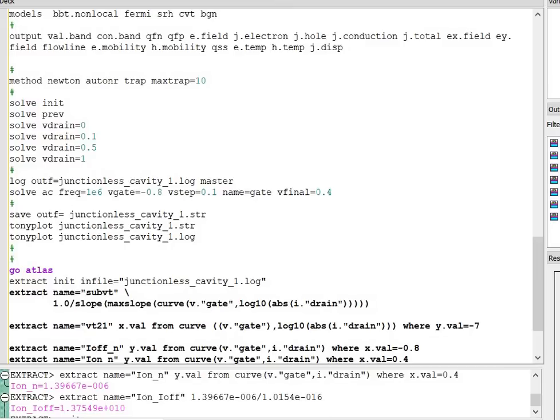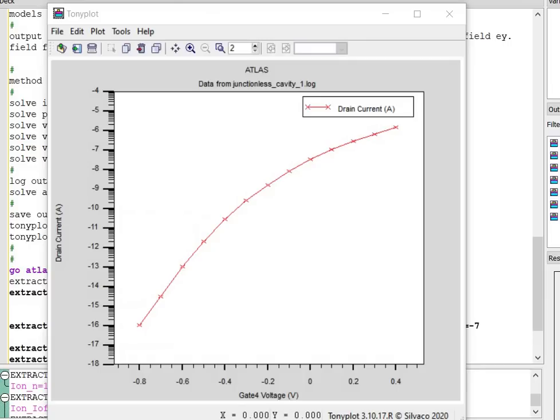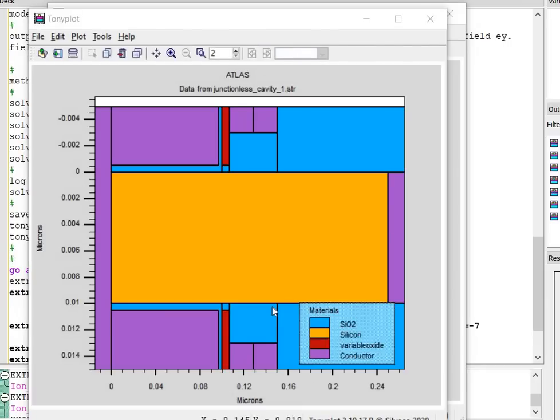When you run this program, again you are getting two files. One is the structure file and one is the log file. This is the log file. This is the structure file. You can check the material. I have introduced oxide material with the name of variable oxide. And the substrate doping is 10 raised to power 19.